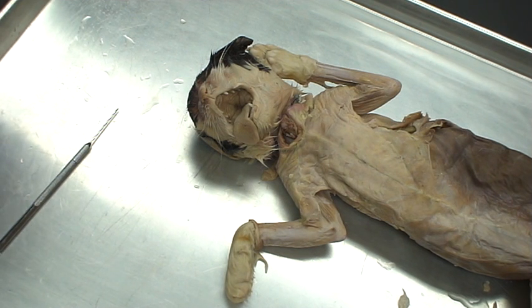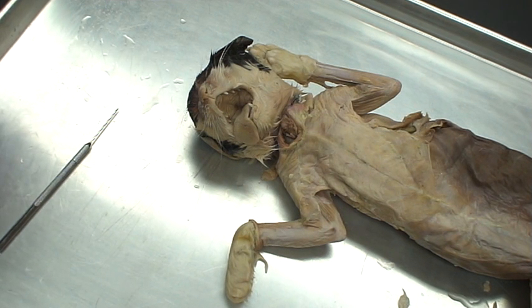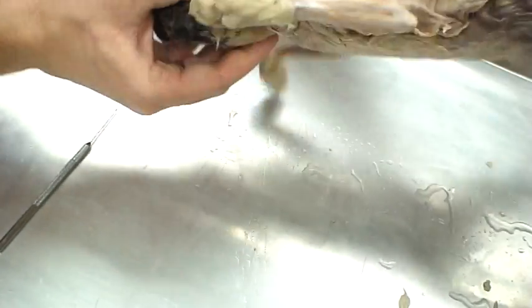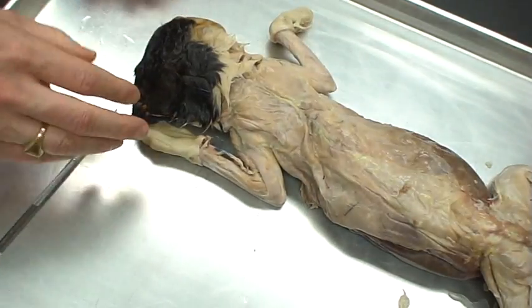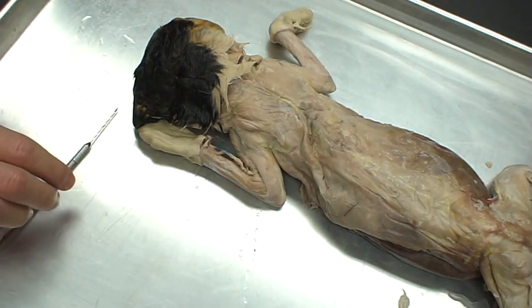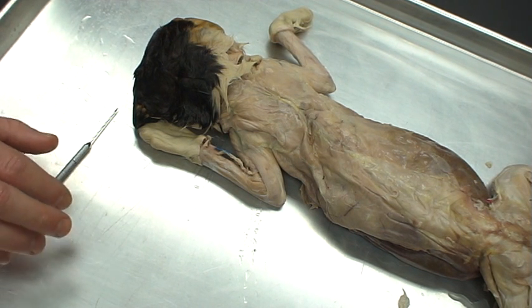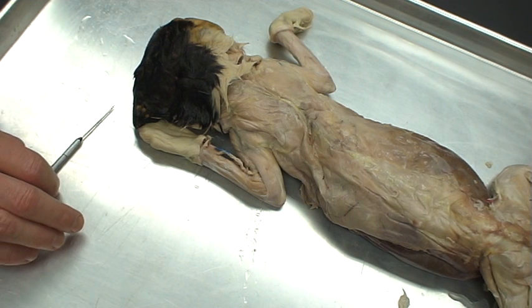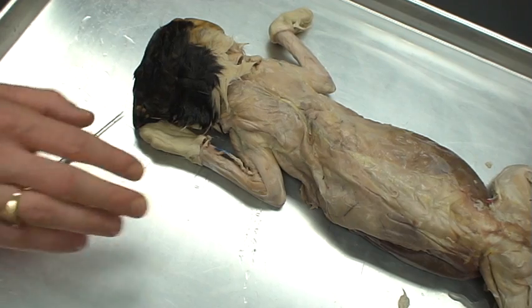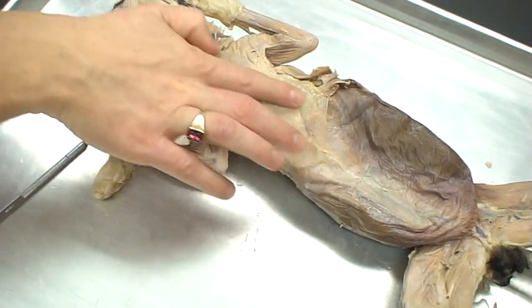We're going to start by taking a look at some body regions and external structures on the cat. On our checklist we see several terms that we'll use throughout all of our dissections. We're going to start by describing the dorsal region. The dorsal region on the cat is obviously going to be the back. This is slightly different in humans because our dorsal region is still our back, but the cat's orientation as a quadruped is slightly different than what we'd normally expect. For the cat, the dorsal region is the back and the ventral region, just like in humans, is the stomach.